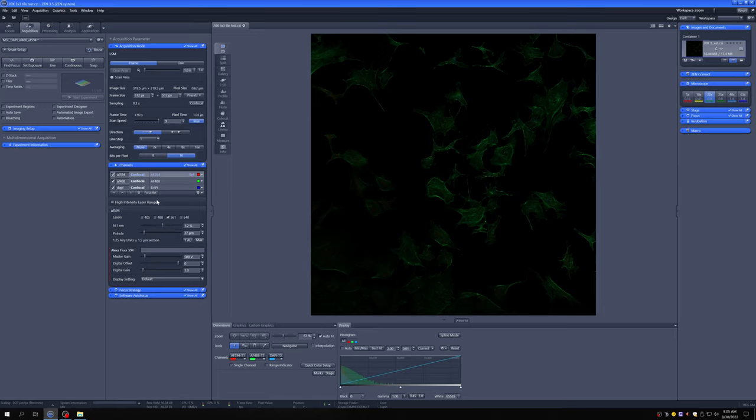What we recommend is to make it one airy unit for your longest wavelength dye, and then to make sure that that value is the same for all the other ones, even if the airy units are not the same. So if I click on 1AU, that will make it one airy unit, which is 30 microns, and we need to check and make sure that the other ones are also at 30 microns. By design, on any of the three channel settings, when you press 1AU, all of them will have the proper value, which you'll notice it may not be one airy unit for DAPI, but that's fine. It needs to be one airy unit for the longest wavelength dye and then the same number here for all the rest, which it is.